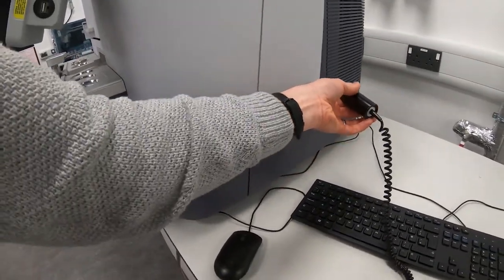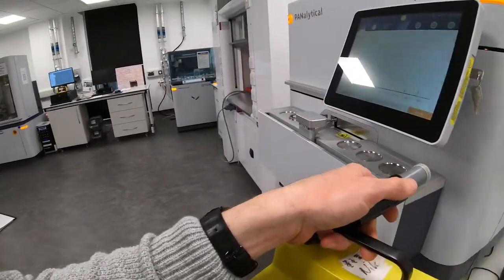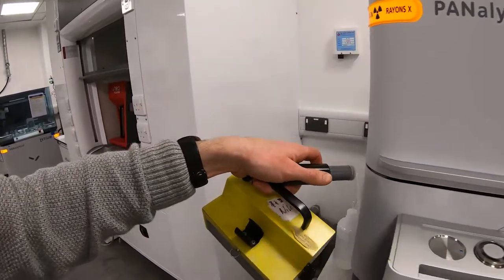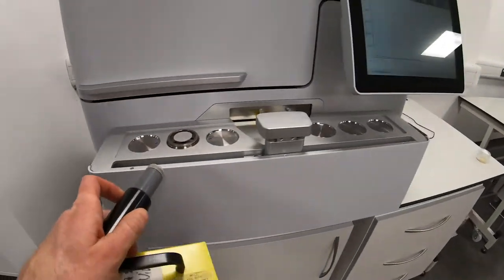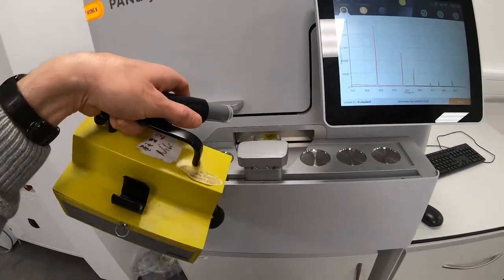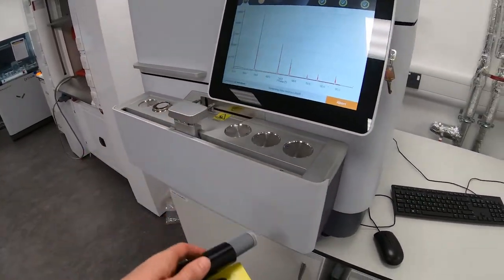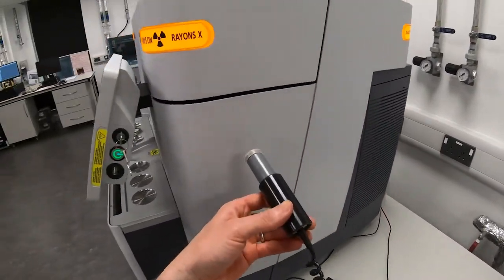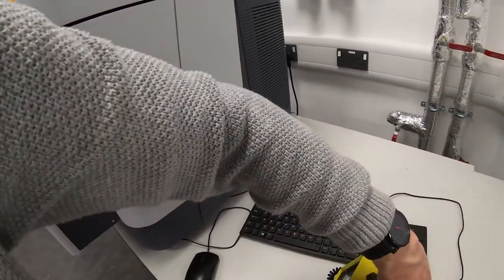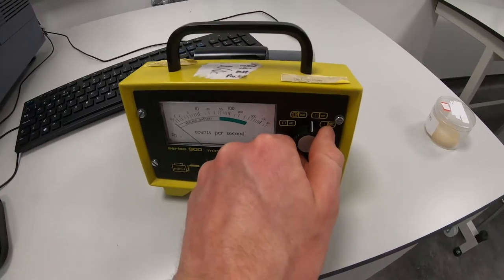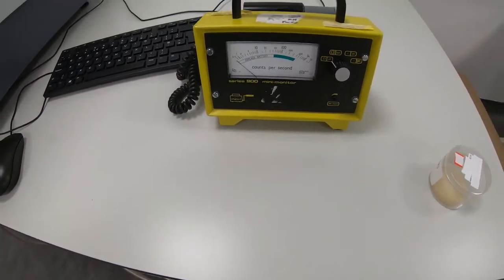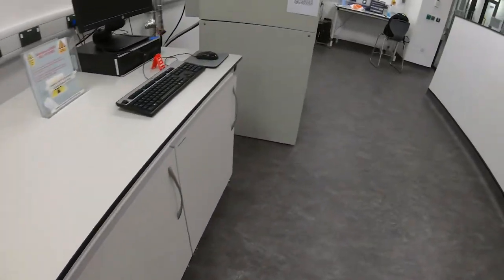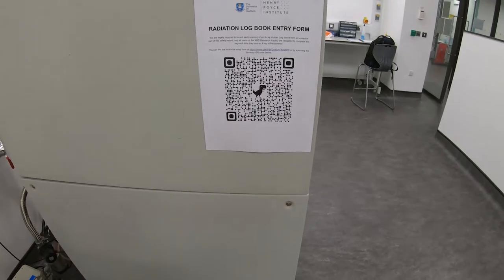Now we're going to use this to scan around the area listening for counts. I'm going to follow the creases around where the x-rays are pointing. I'm getting less than one count per second here with this monitor. I'm going to move it around looking at the seams again here and the other side. Go to the back, you can see this panel is missing, but we're going to leave this off all the time so we can see the water, around this shutter area. You can see that there is no x-rays escaping from the body of this. So I'm happy, I didn't hear a lot of clicks which is great news. I can put this back in here and it's very important that we turn it back to the off position again.